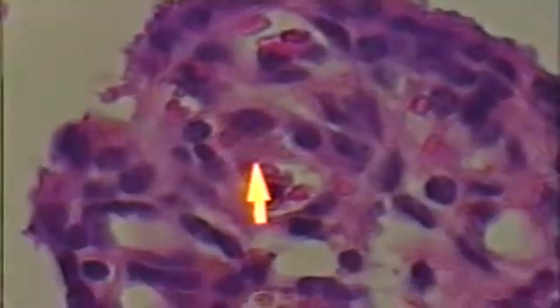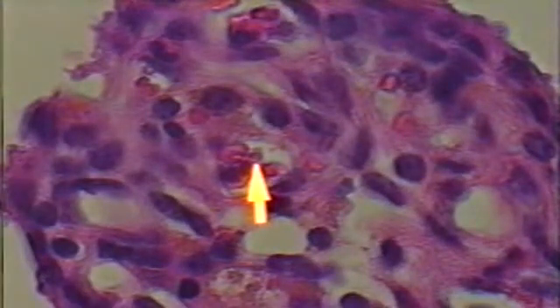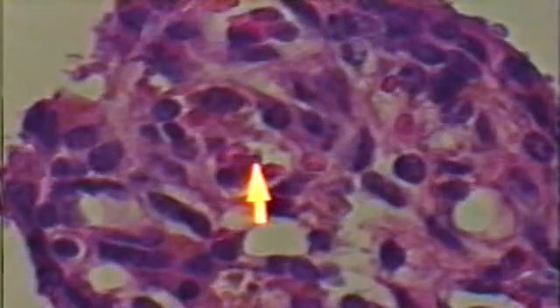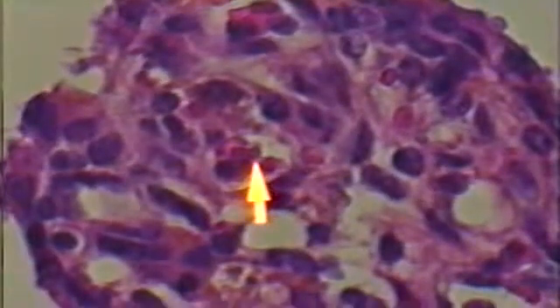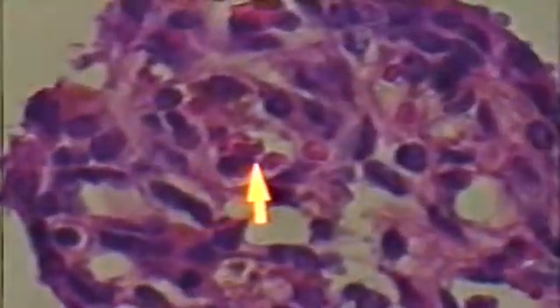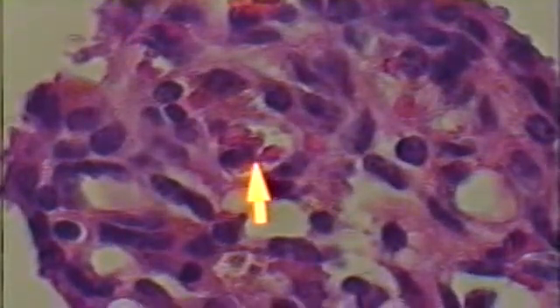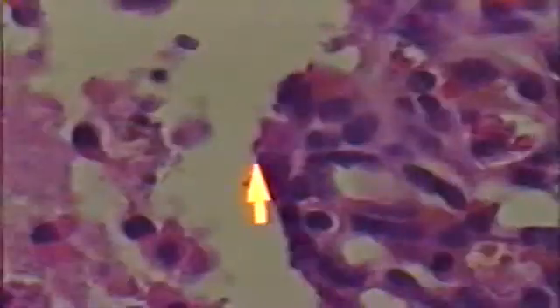Underneath and in amongst the connective tissue of the villi, you should be able to find red blood cells. If you focus back and forth on many of these, you'll even pick up the idea that these are biconcave discs as described in introductory biology. You'll also notice white blood cells, and many of these are on their way into the lumen in an attempt to fight off the infection.